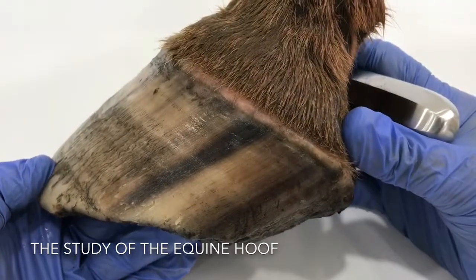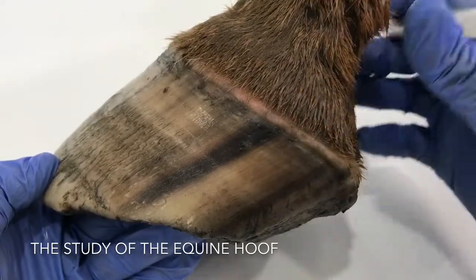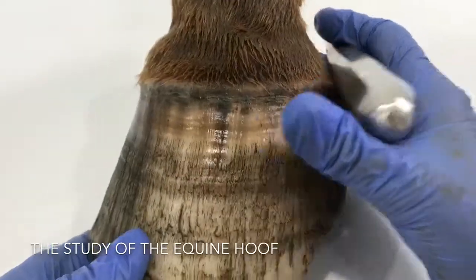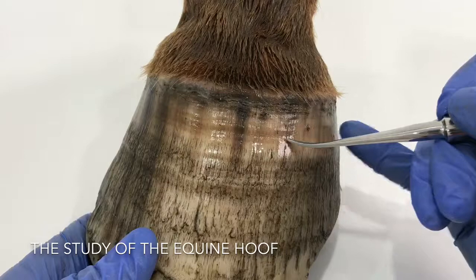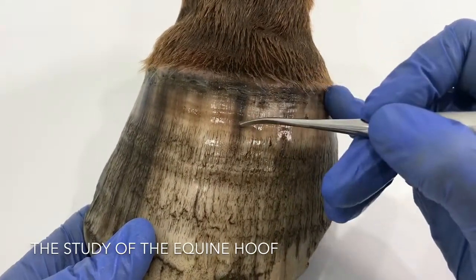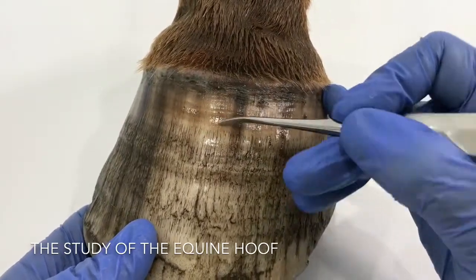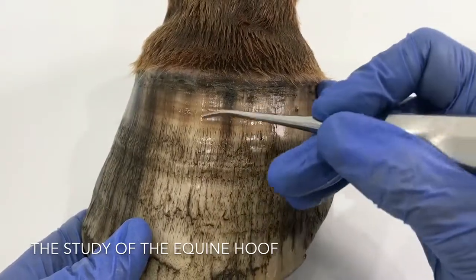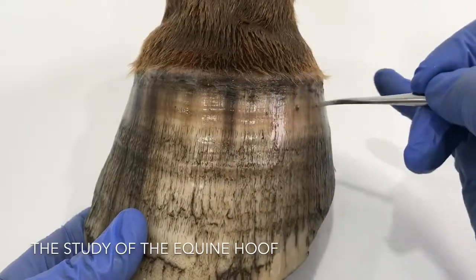That could be a change of diet, a wormer, or something extra that happened to this hoof while it was alive. You can see quite a reasonable dip through there — that's another growth ring. When these tubules were being formed up here for this growth ring, something happened in this horse's life to change the way the tubules and the intertubular horn were growing, and that's why we're seeing this line through here.